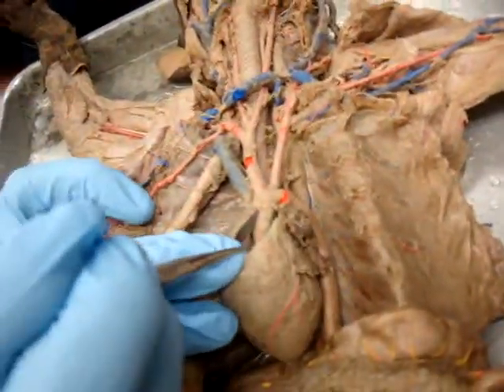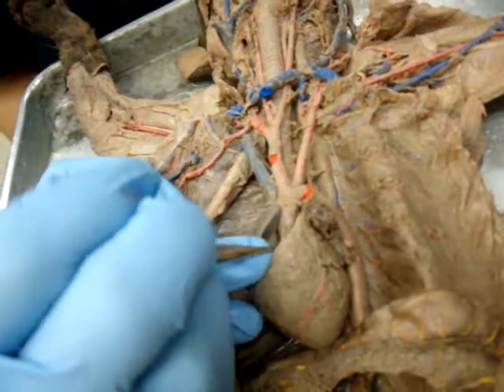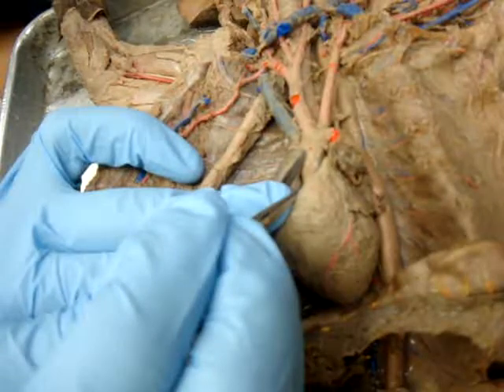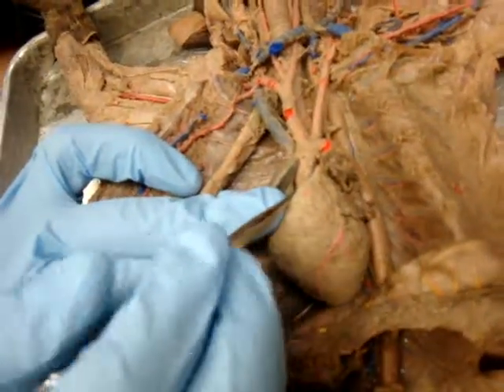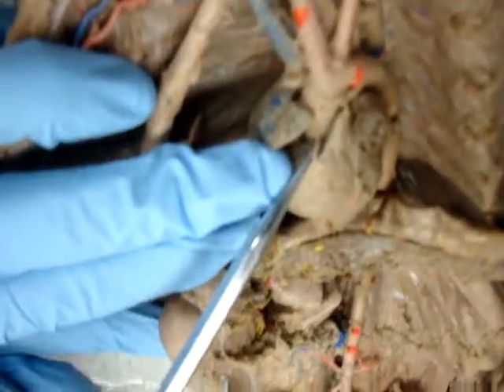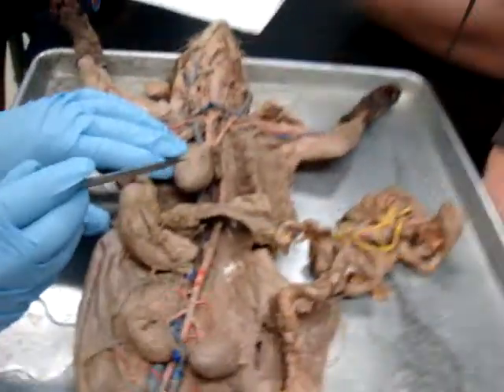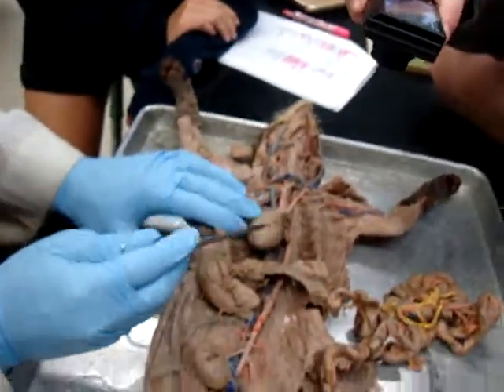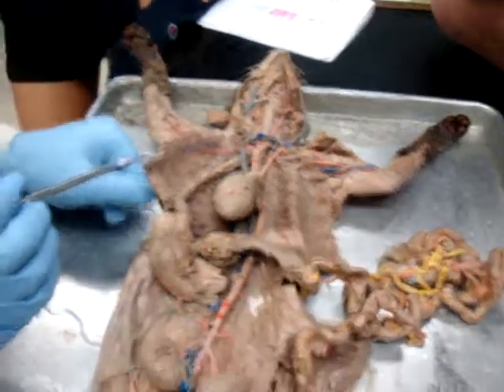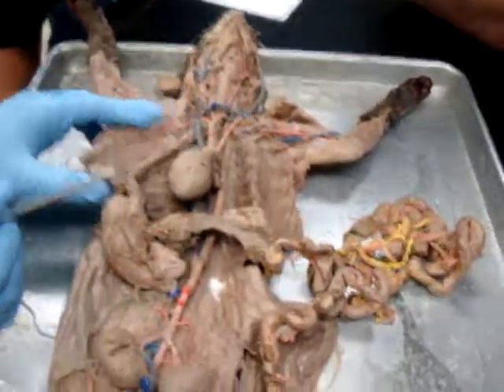but oh yeah, right there. That is a coronary artery. The blue and the red, and the red is the artery. And that is going to be a very, very small right coronary artery. Now, we would never point that out, but it's nice that we can see it. This here is anterior interventricular. There's right ventricle, there's left ventricle. So anyway, let's carry out the aorta some more.